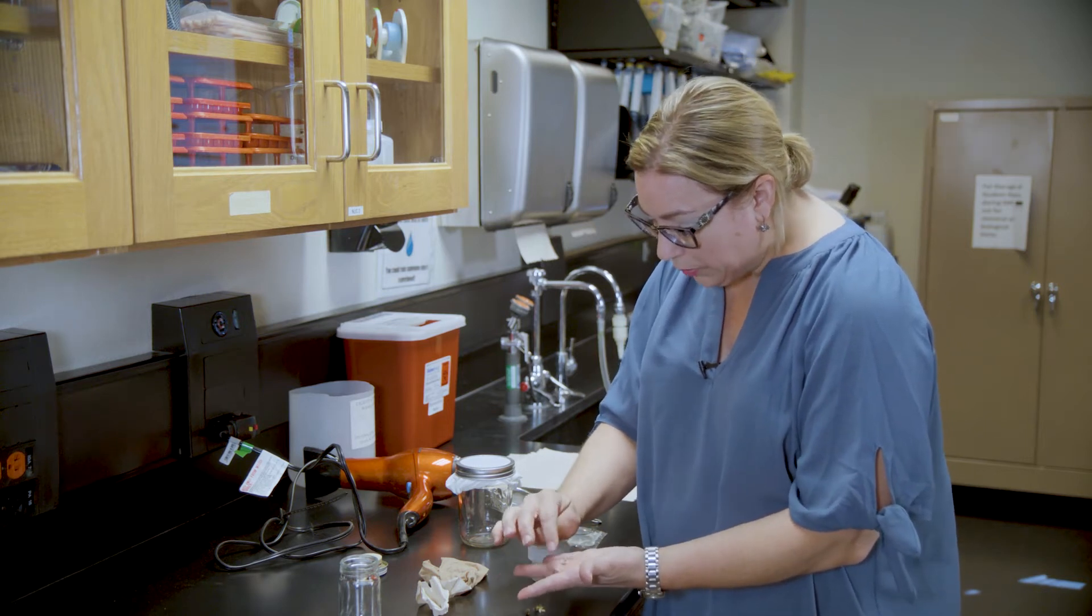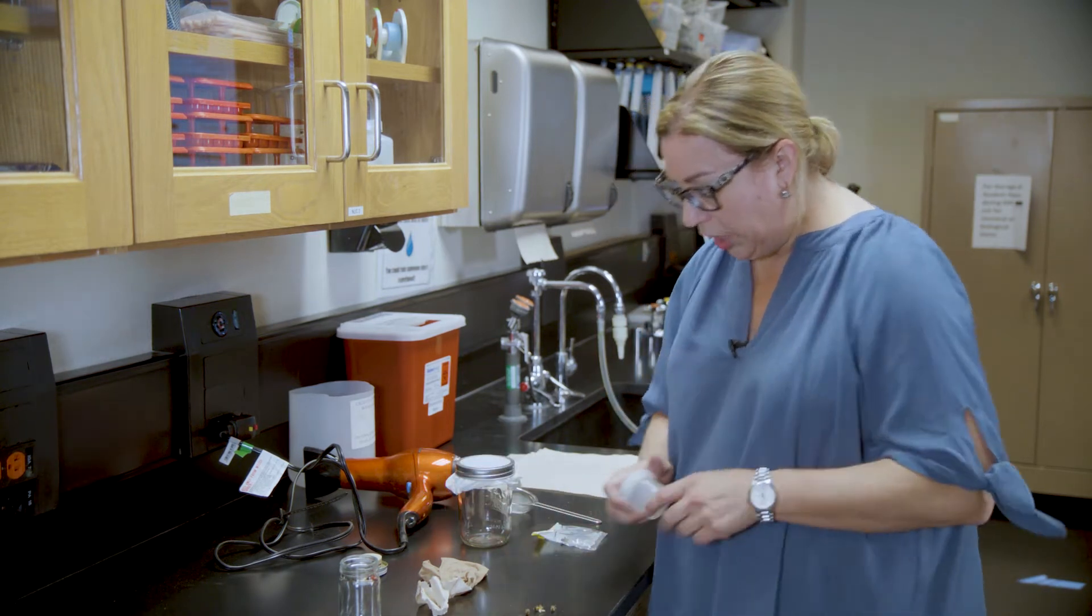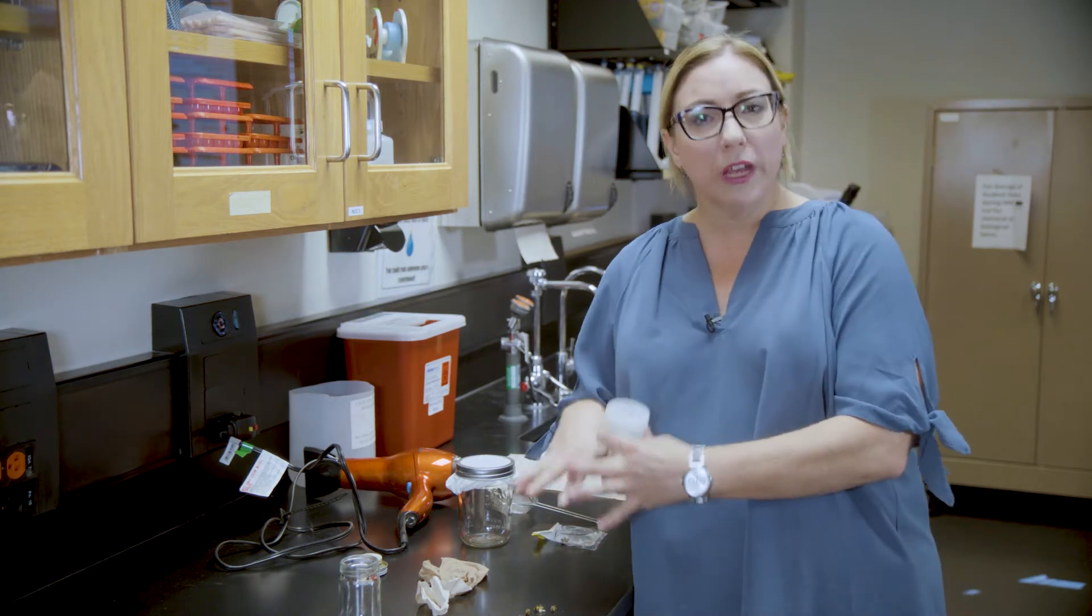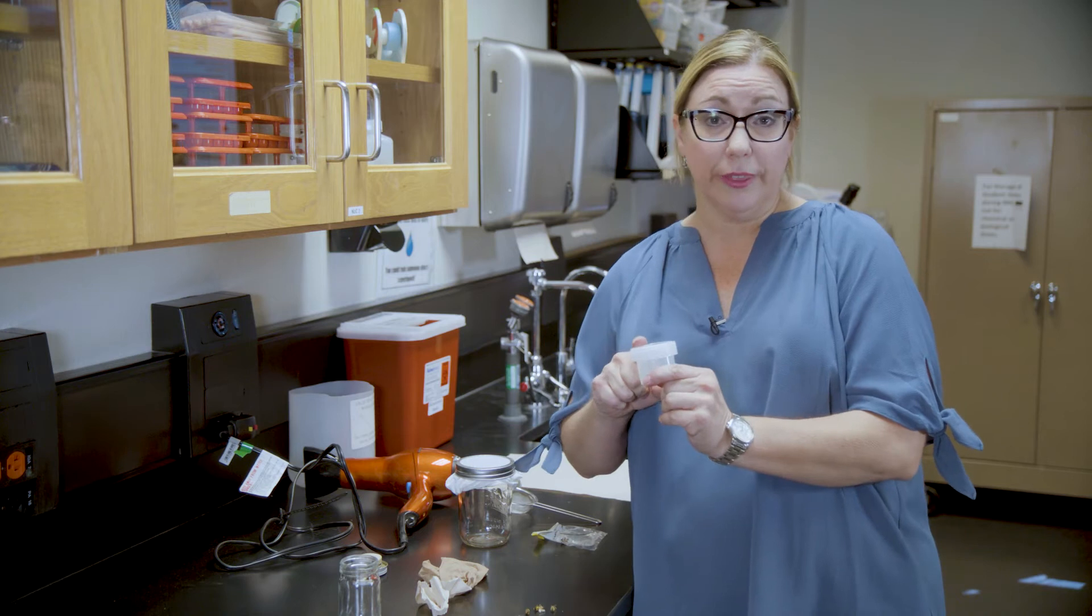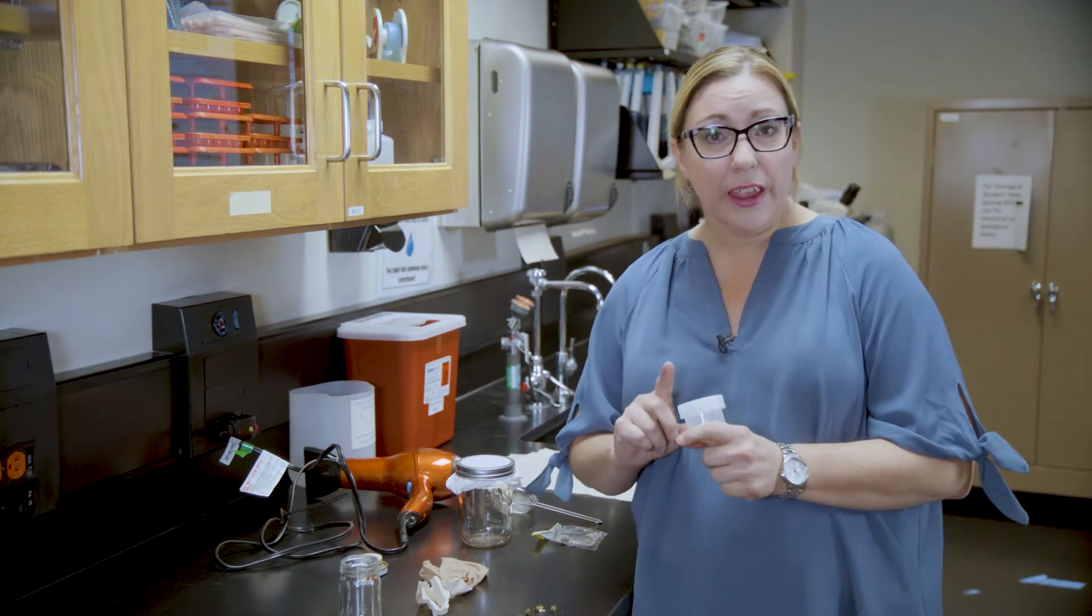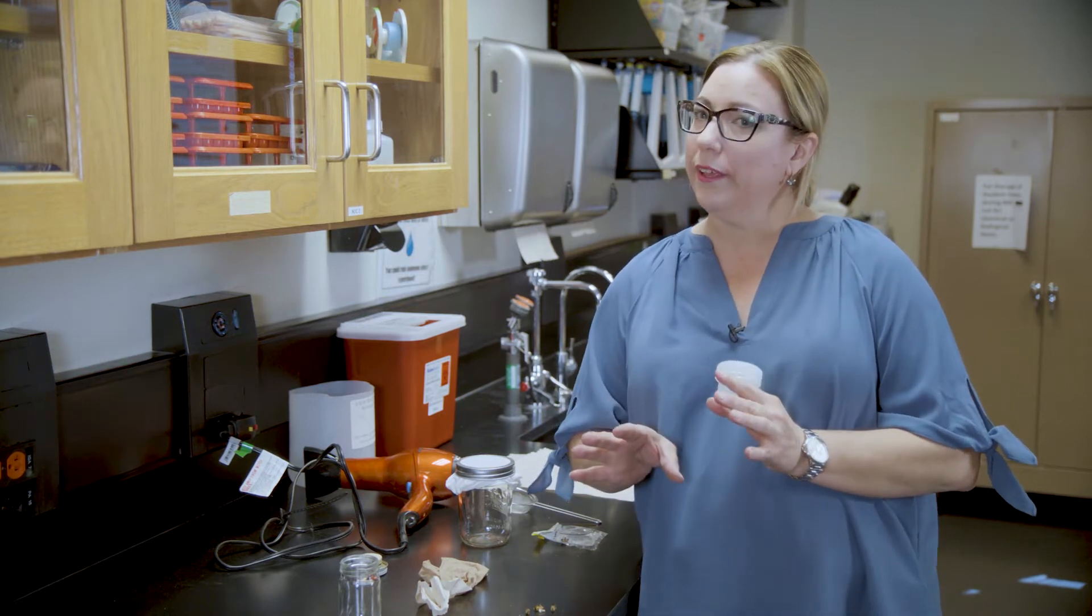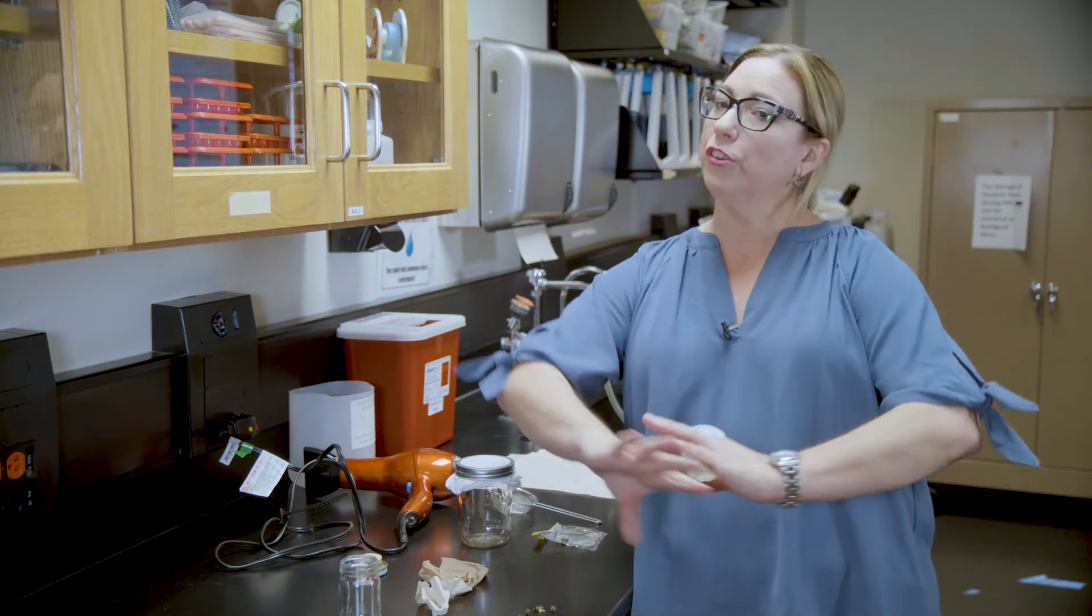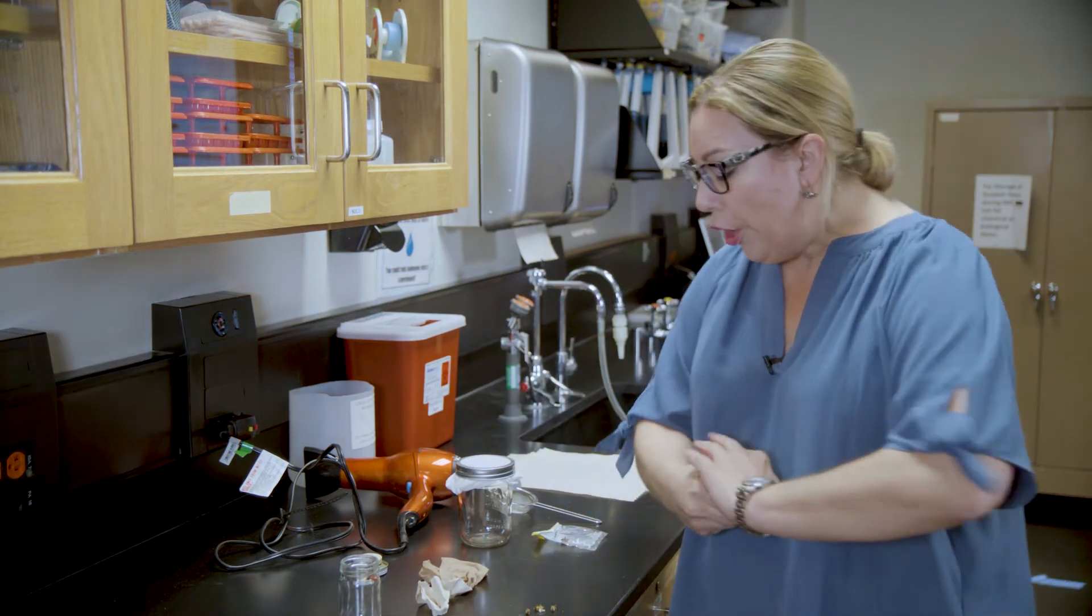Now what you want to do with these bees is put them in a storage vial. If you're going to mount them immediately, you don't need to do this. But when you collect bees, they can stay in your freezer for about a week. If you leave them longer than a week, you will have to relax them, which is a whole different process.